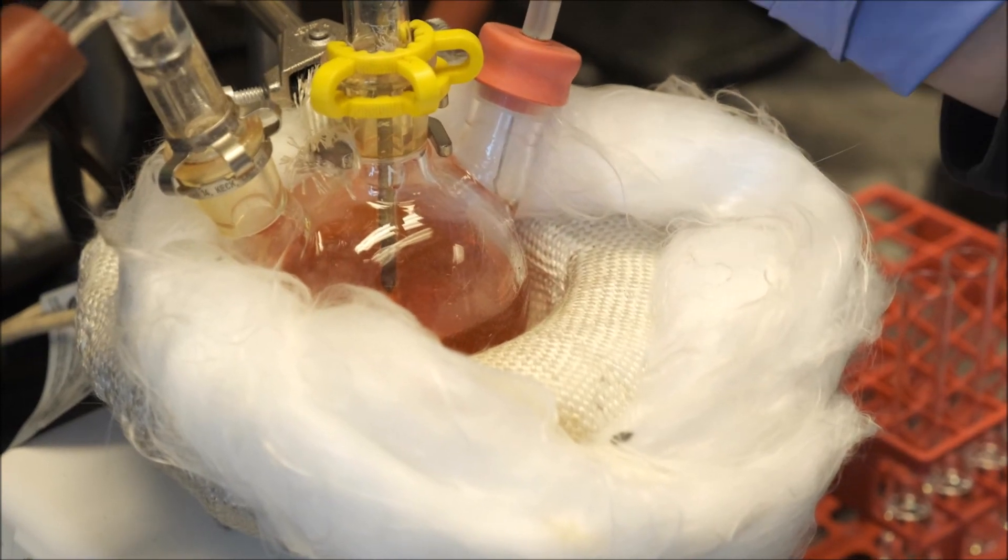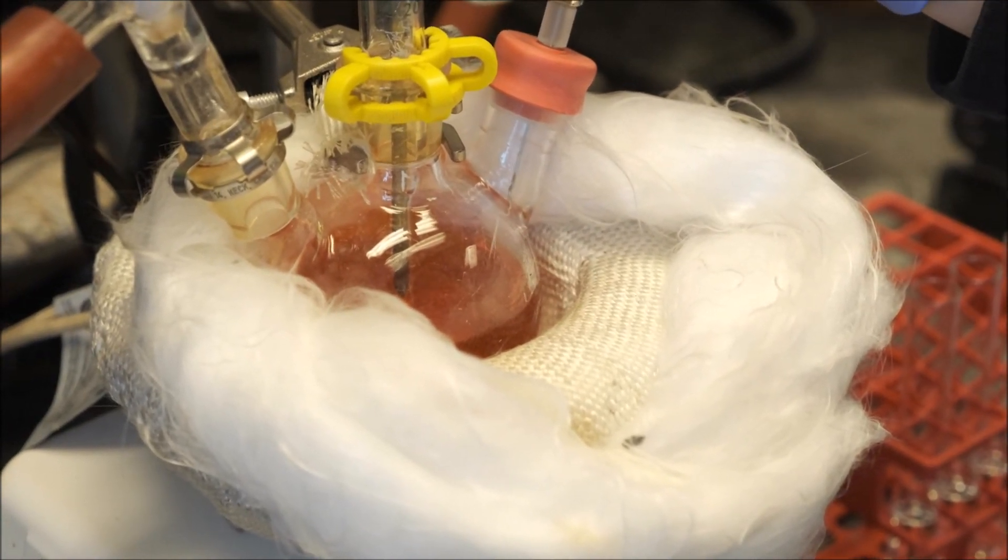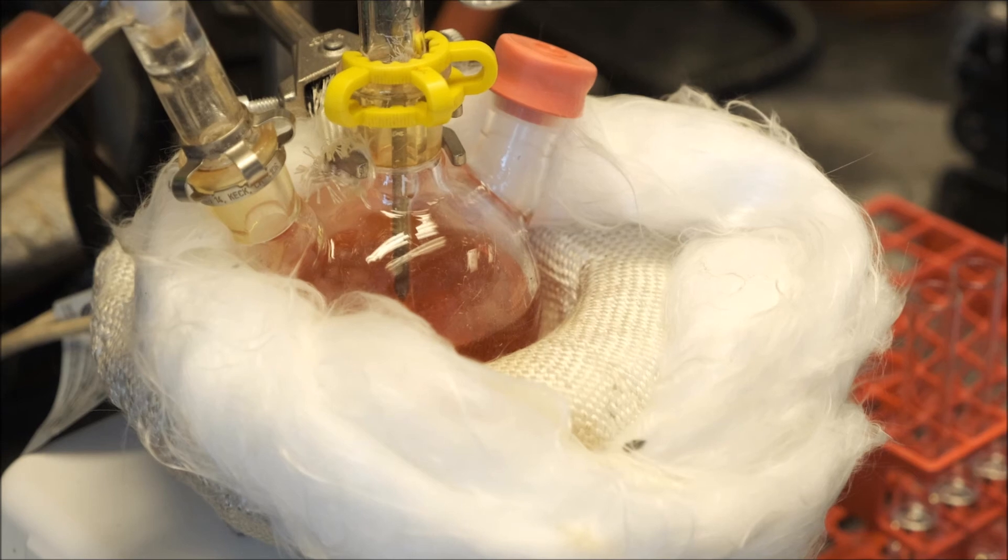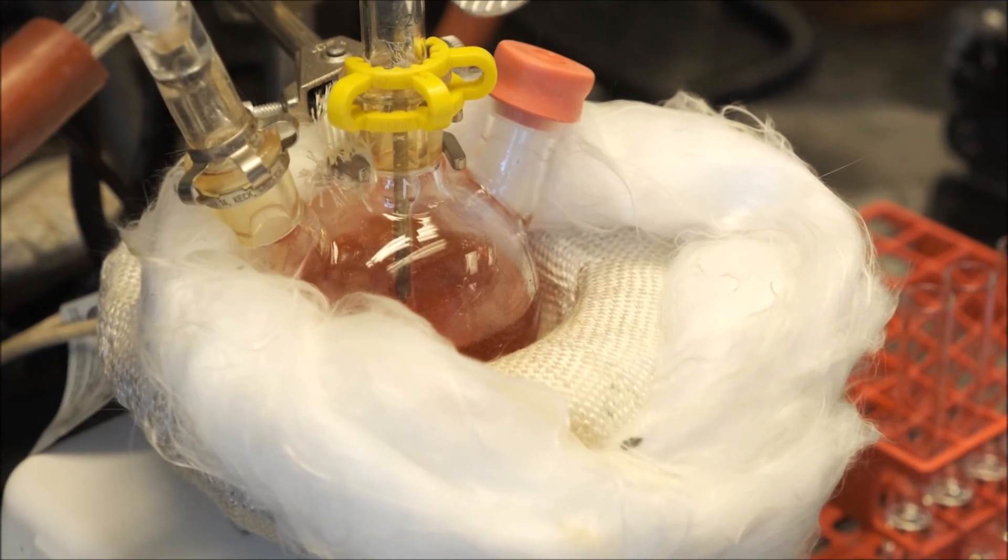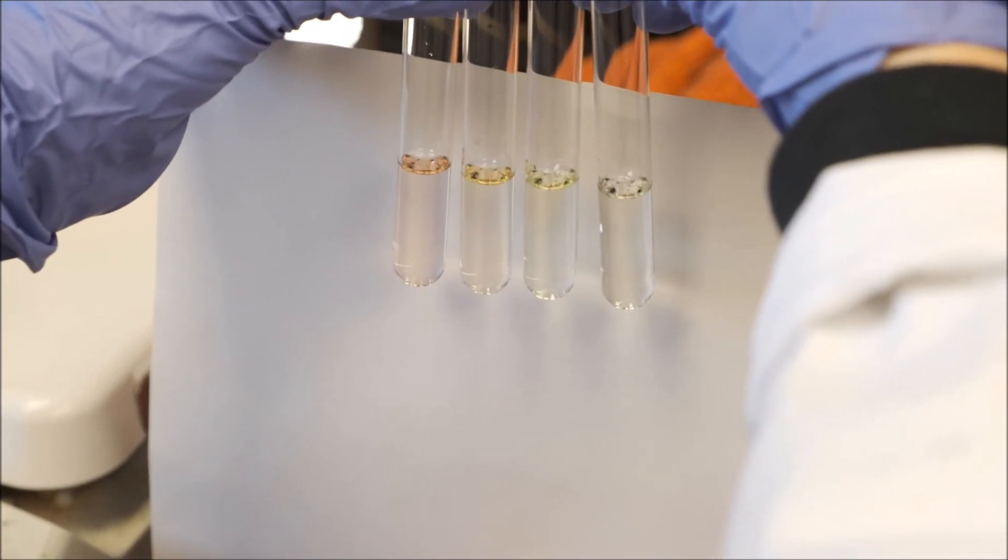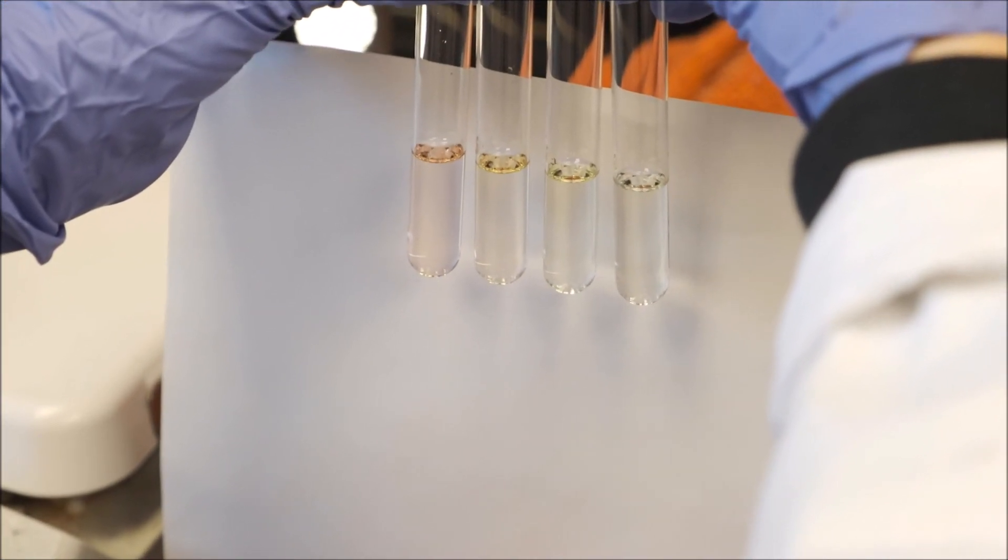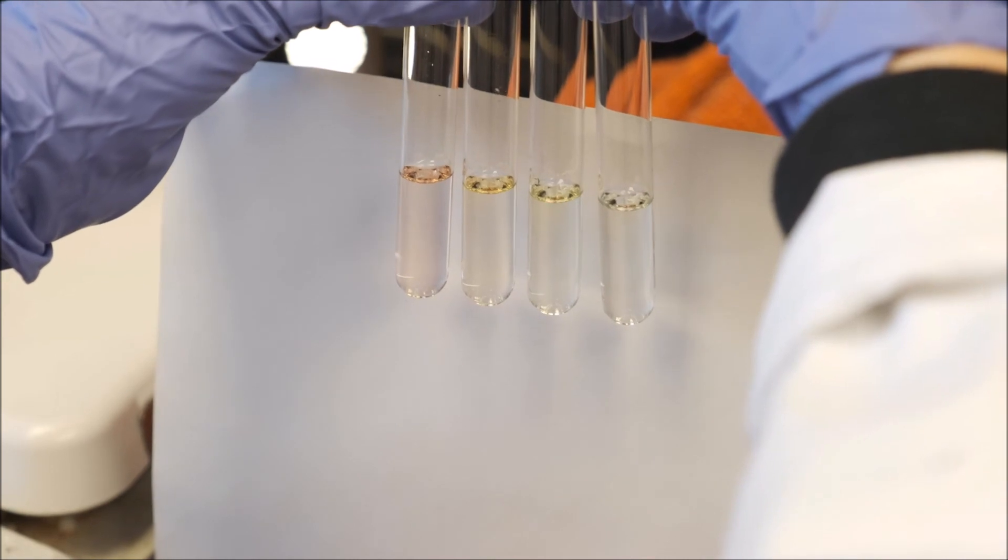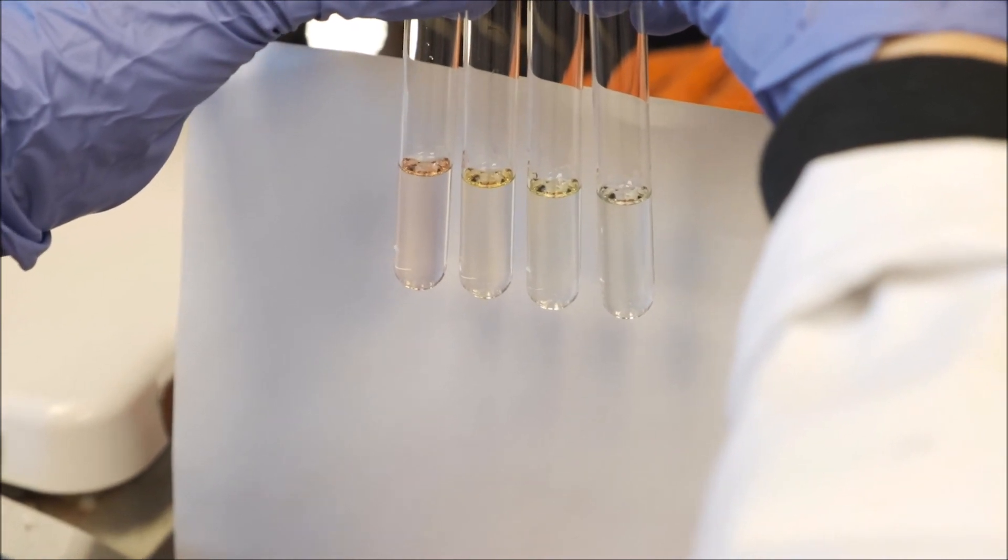This reaction is much slower compared to the cadmium selenide synthesis and can take up to 40 to 60 minutes to go to completion. The different aliquots exhibit colors ranging from yellow to reddish orange due to differences in absorption wavelength as a function of size.